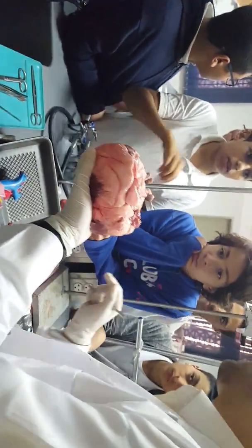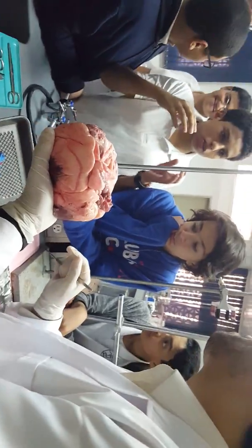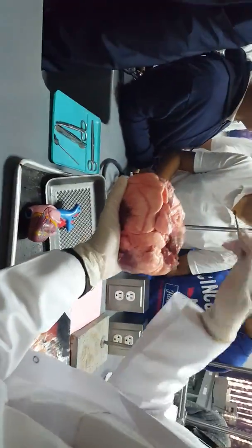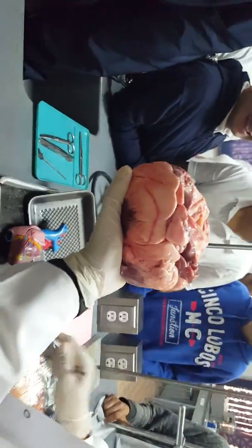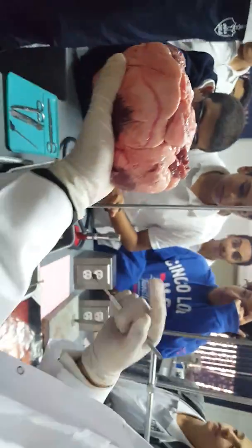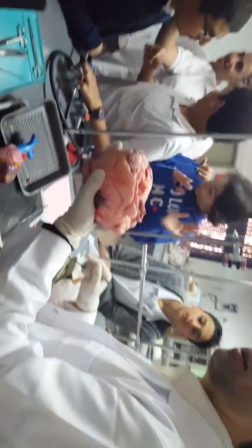Yeah. It says in the book that too much fat can stop the blood from moving. Too much fat inside the vessel, not outside surrounding the heart. Yes, 1 second please. Yeah, I'm going to talk about it here. How did you construct the coronary bypass? The bypass. Let's read it in the diagram. It's going to be much easier.